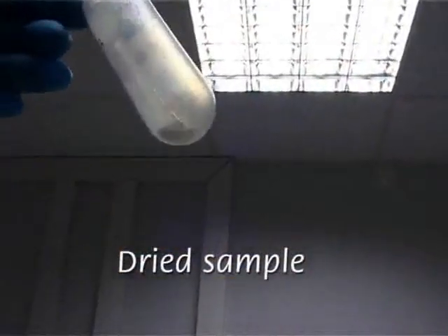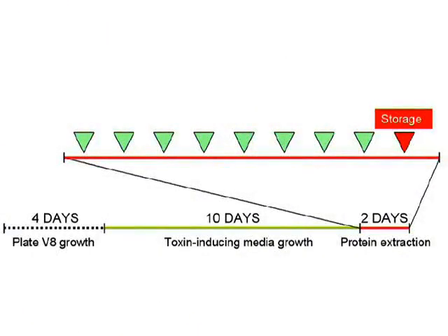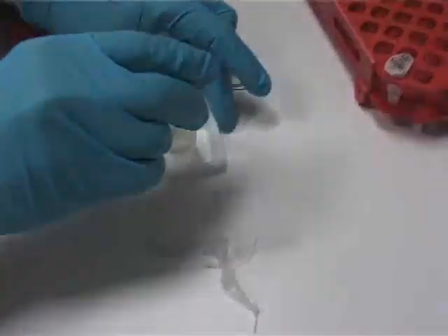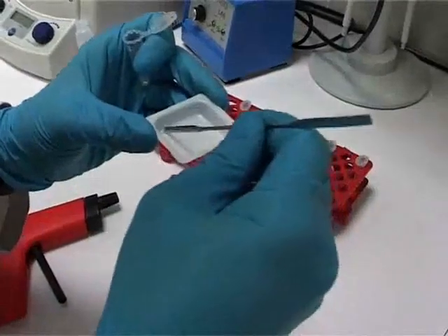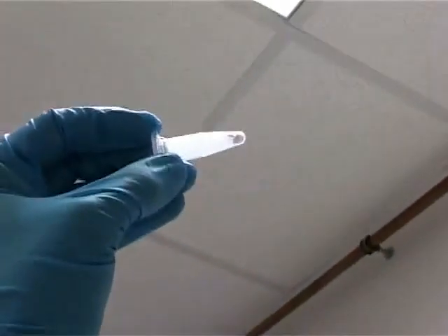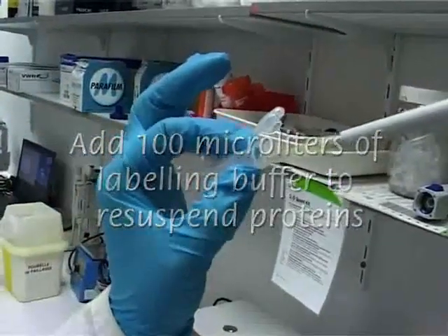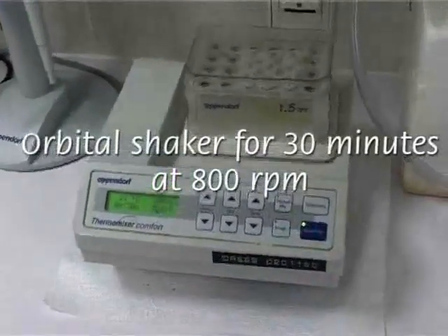When the sample is dried, the protein is of powder-like consistency. To store the sample, proteins should be collected from the tube. To diminish the electrostatic interference of plastic, an electrostatic pistol is used and the protein powder is collected using a metal spatula. The proteins are then resuspended directly in the labeling buffer used for 2D DIGE. 30 minutes at 800 rounds per minute suffice for solubilizing the protein.